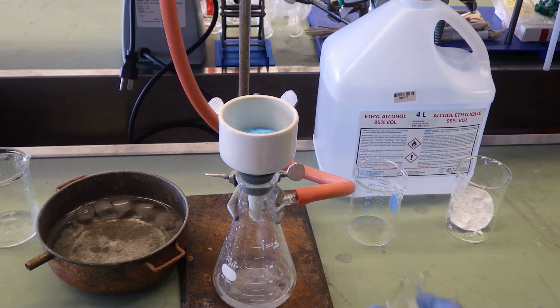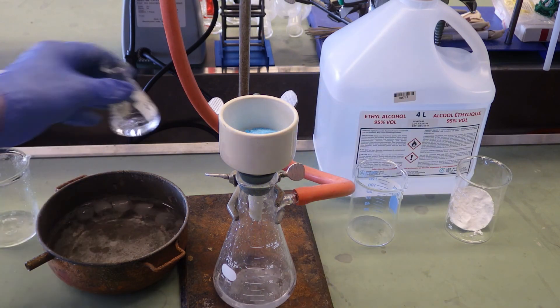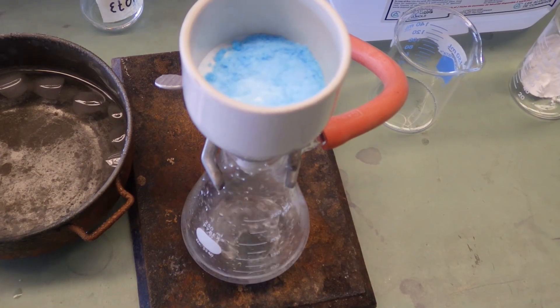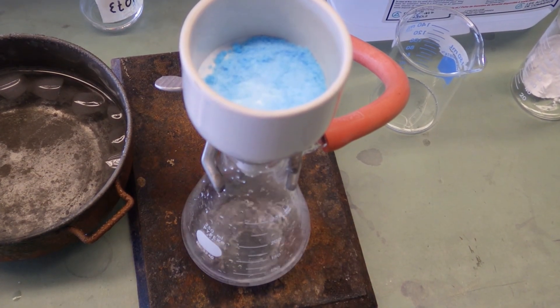One rinse, one final rinse. All right, there's our CSP product.